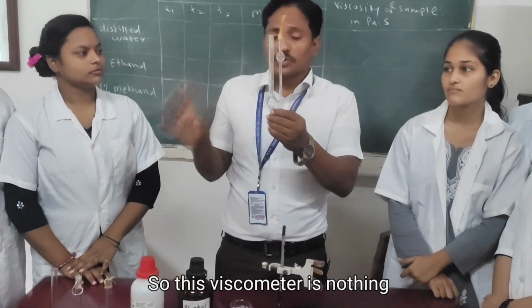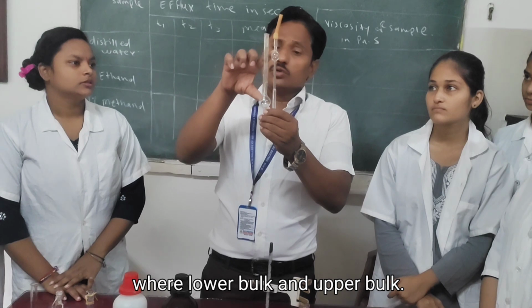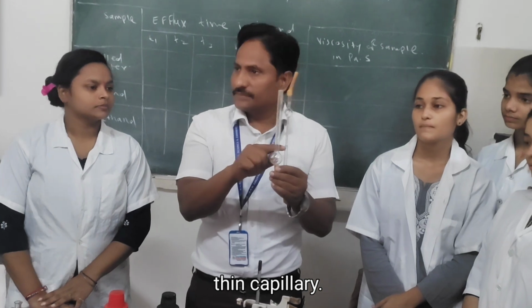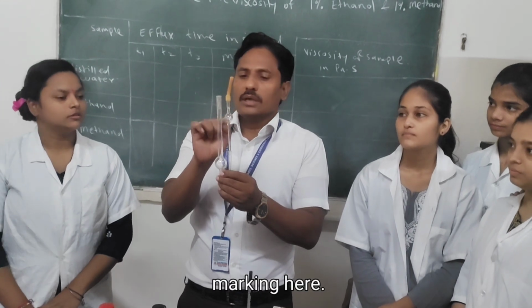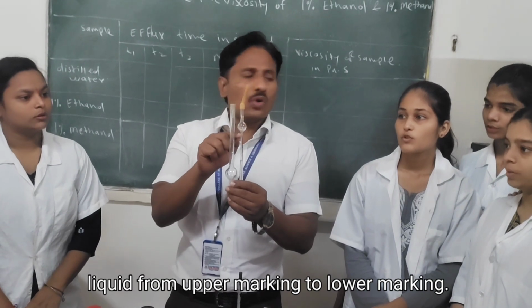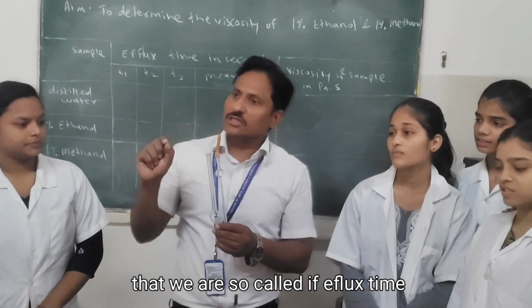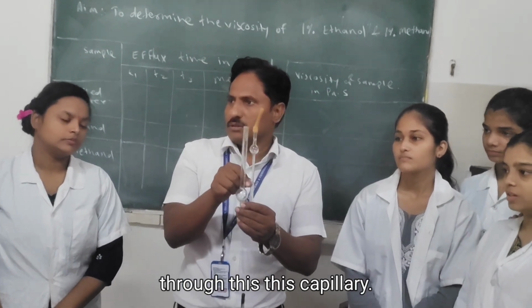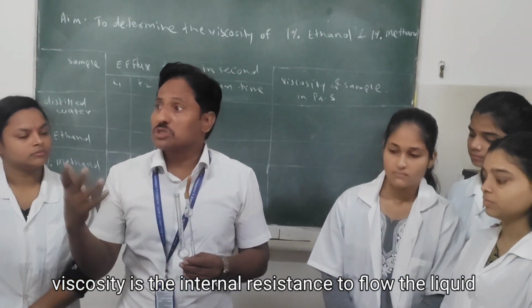So this viscometer is nothing but a U-shaped glass tube, with a lower bulb and an upper bulb. These two bulbs are connected through a uniform thin capillary. There are two markings, an upper marking and a lower marking. We have to measure the time of flow of the liquid from the upper marking to the lower marking. That we also call efflux time, or flow time, for the transfer of liquid through this capillary. The diameter of this capillary is in millimeters. Viscosity is the internal resistance to the flow of a liquid.